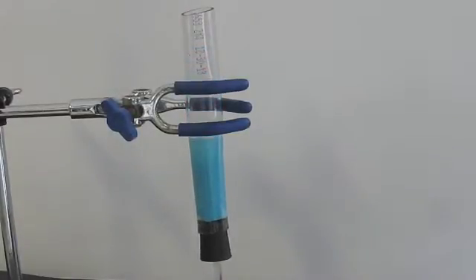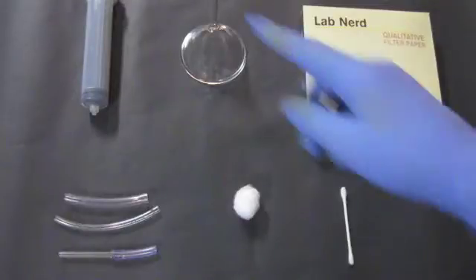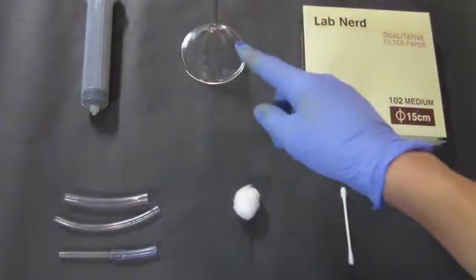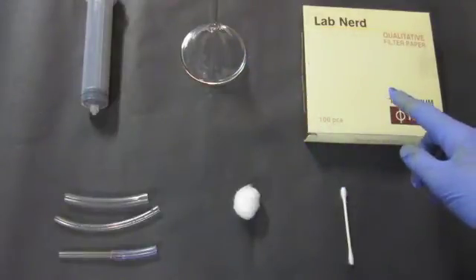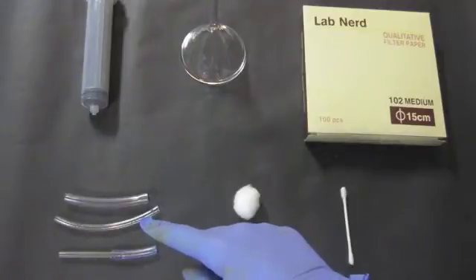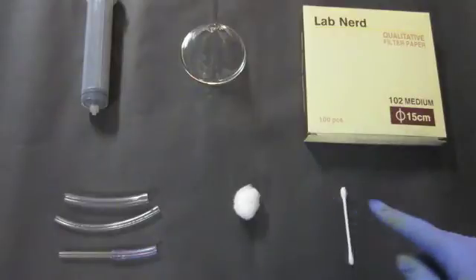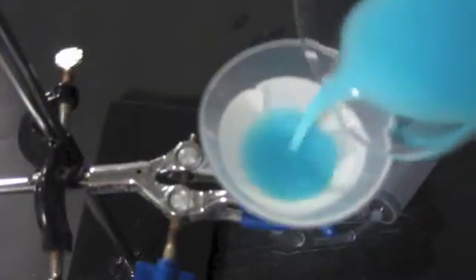In this video, I will show you how to create a vacuum filtration setup for under $10. For this project, you will need a large syringe, a funnel, filter paper, appropriately sized vinyl tubing, a cotton ball, and a Q-tip. The first step is to perform the actual filtration.